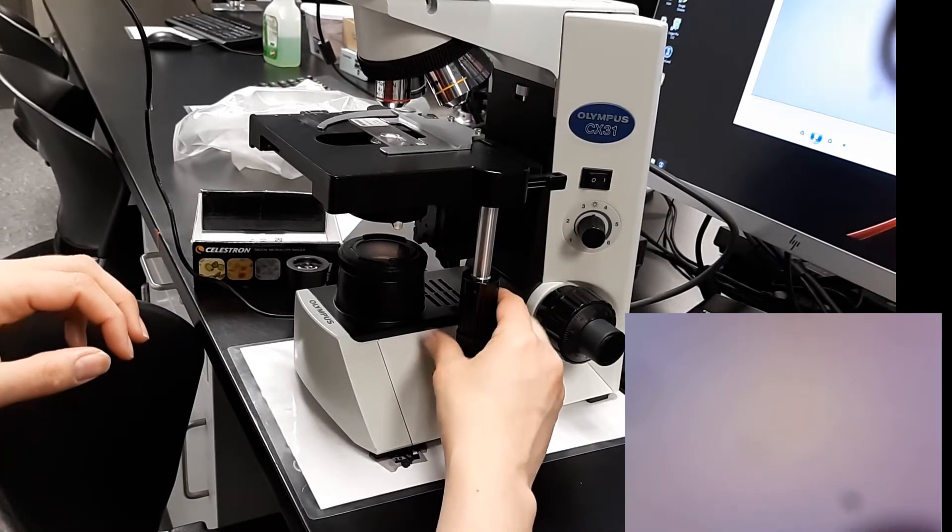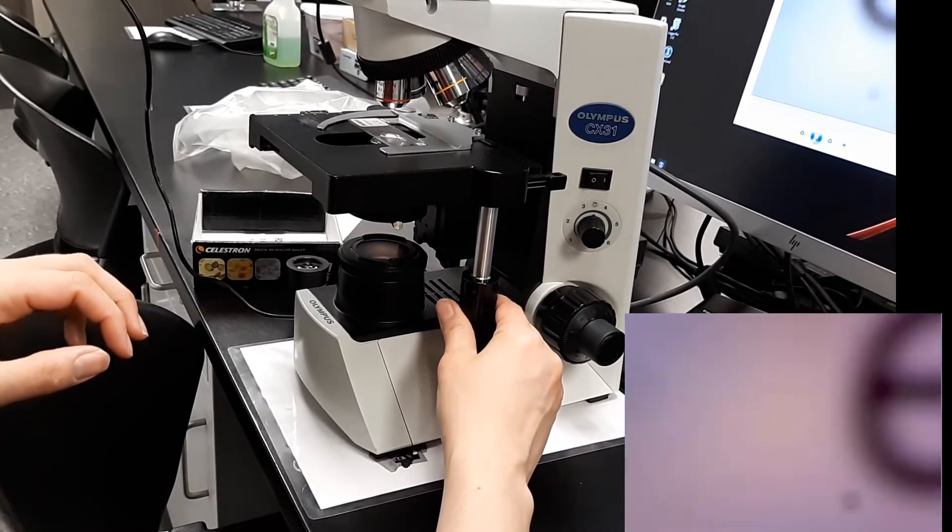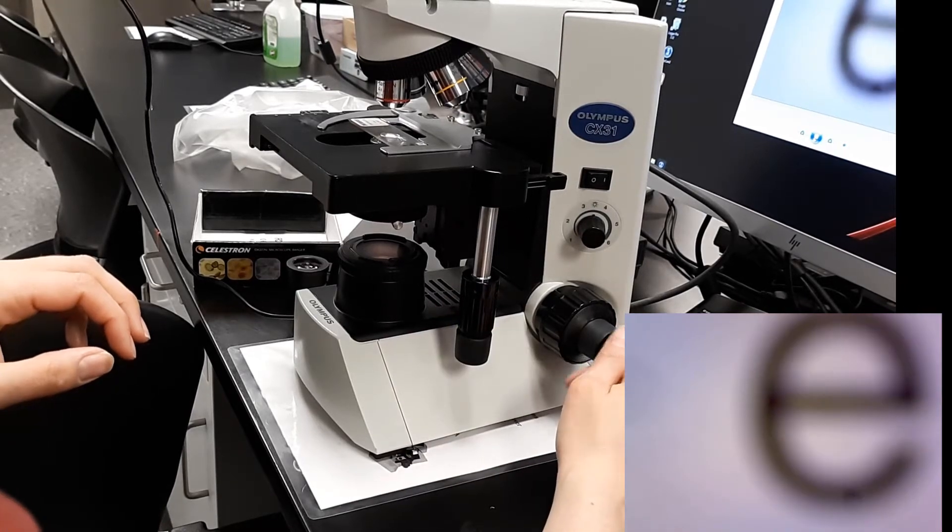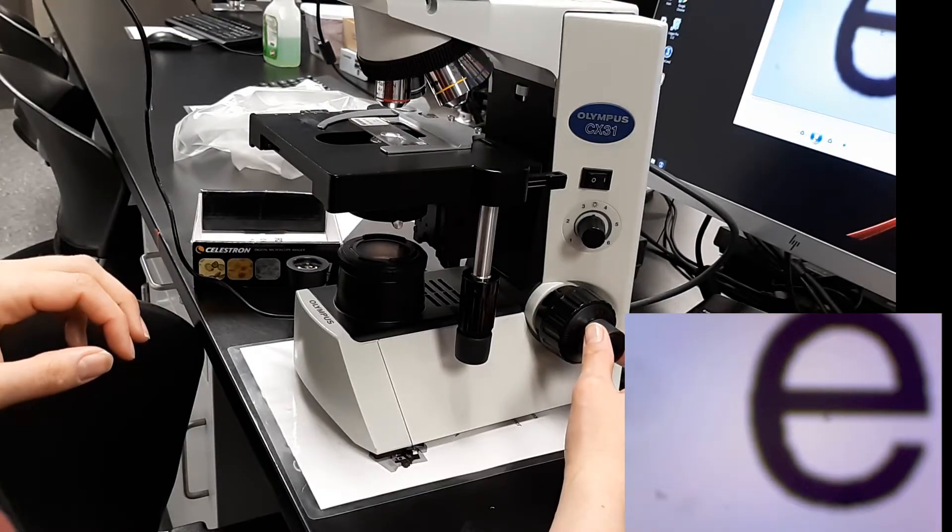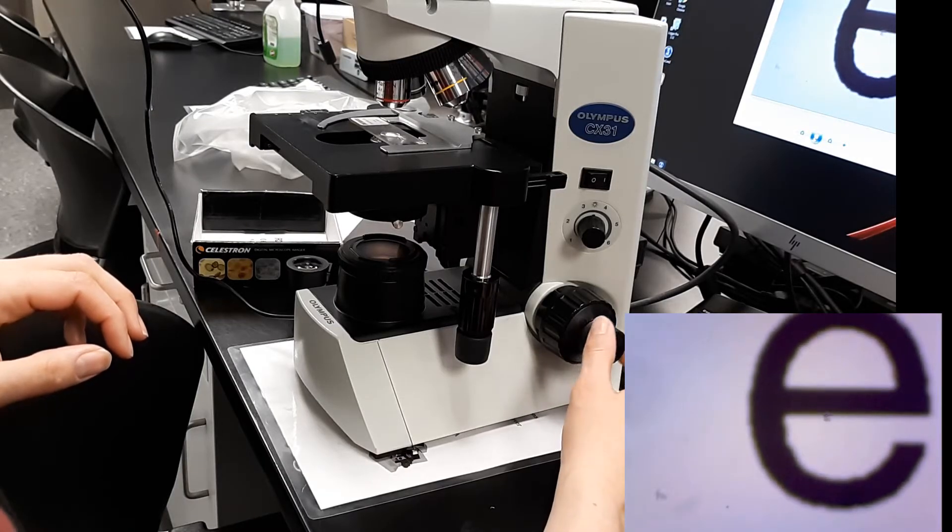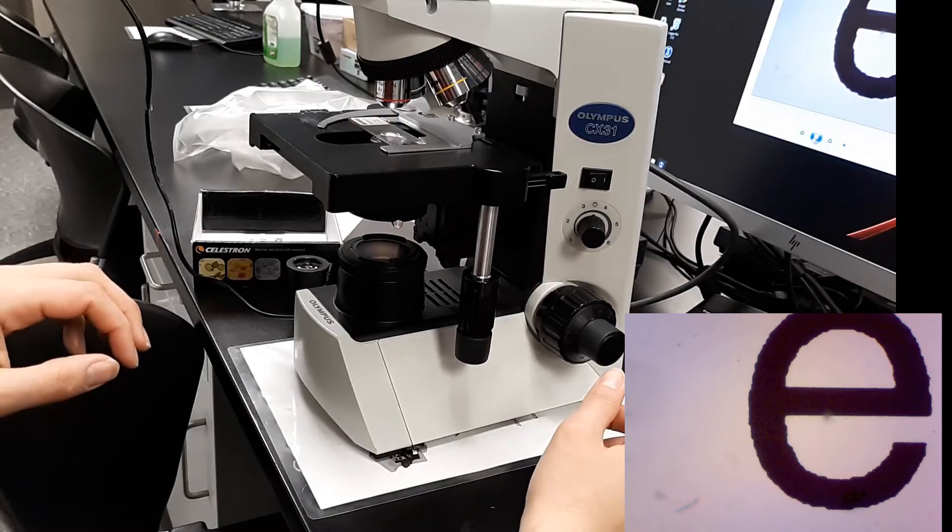And so I've noticed I also have it on the screen here where we can see what we're doing. We're going to fine focus. I'm doing this little baby knob here on the outside so I can see how good it's going to look. It looks nice and crisp and perfect.